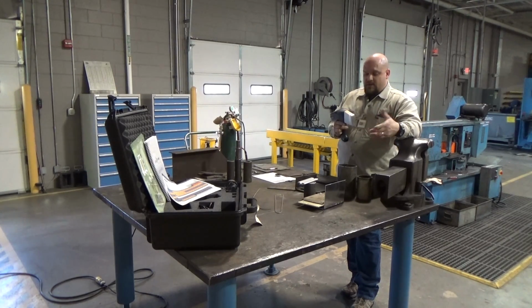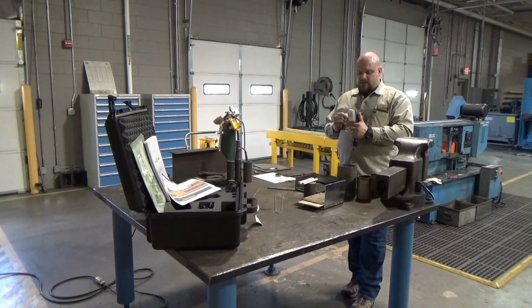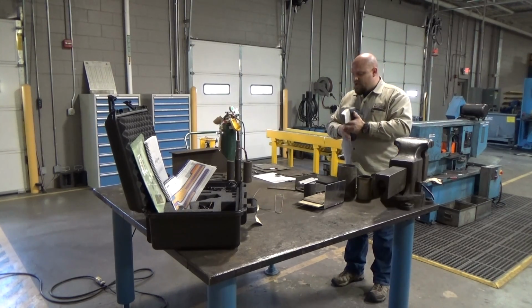And then it will tell you if it is acceptable, if it is calibrated or not, and adjust. The higher the number that you get, the better the reading, the more accurate it is, and all is good. So, the standardization clip, just to save time, I've already completed that action.